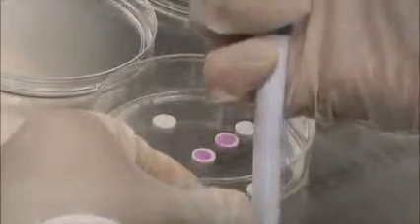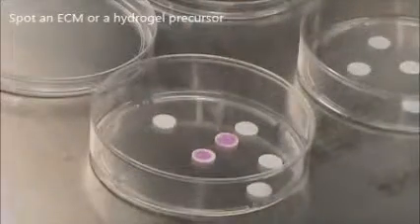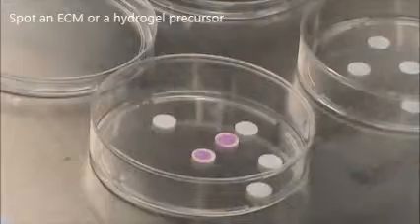When delivering matrigel, ensure that it is kept on ice prior to delivery and use ice-cold pipette tips to prevent gelation during dispensing.